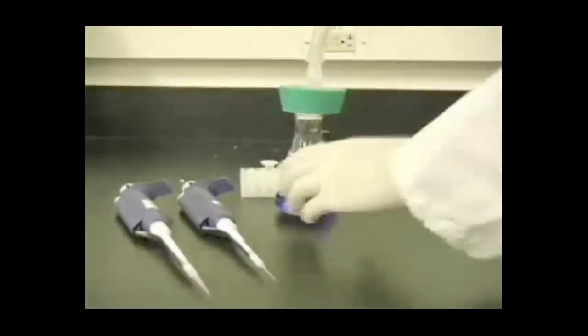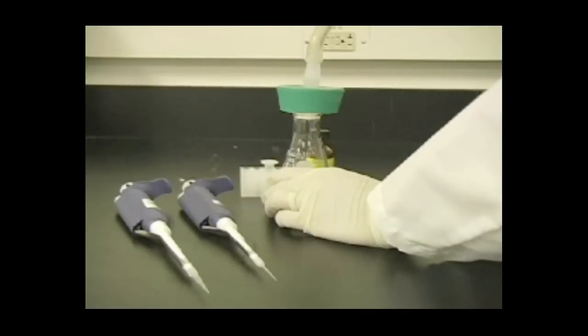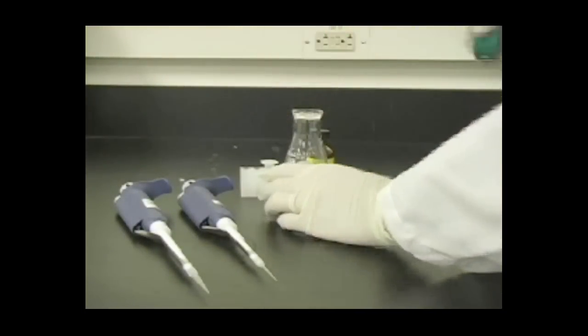In this video we have artificially colored the solution blue so that you can easily see the flow of the solution. Be aware that your solution should not be blue but clear.